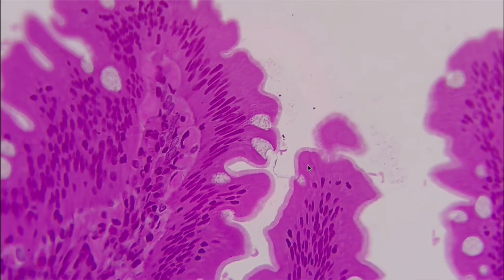Next up, we are going to use that same technique, right? We're looking at the apical surface, the outside, to the basal surface right here. You can tell there's a difference between this cell and these cells down here. But this is going to be our simple columnar, and you can tell because we have these long, thin nuclei, right? We also see a bit of cilia around here, and we can tell that this is one layer, right? We're not getting too messy yet. We just have a simple layer going on there. So this is simple columnar.